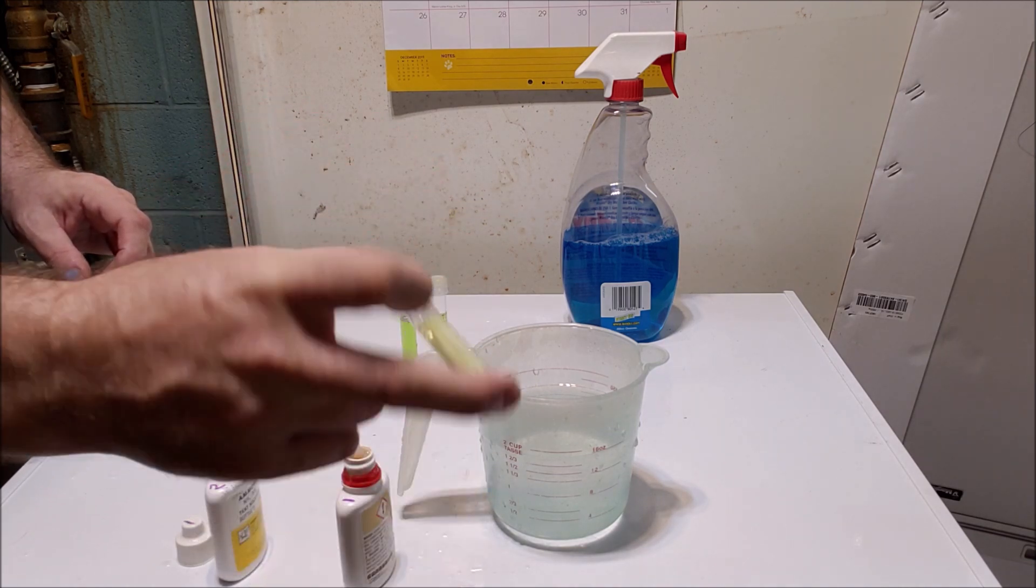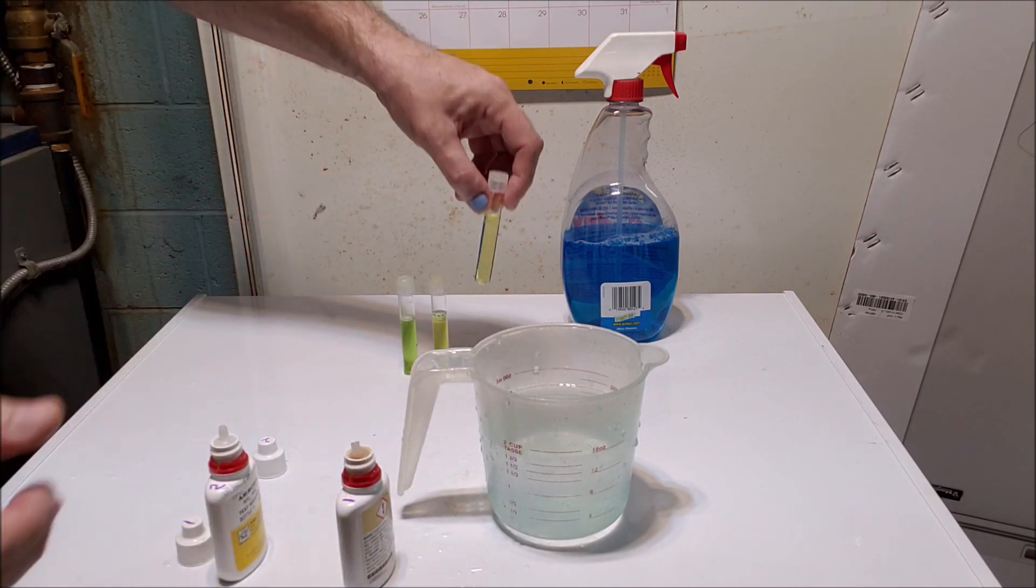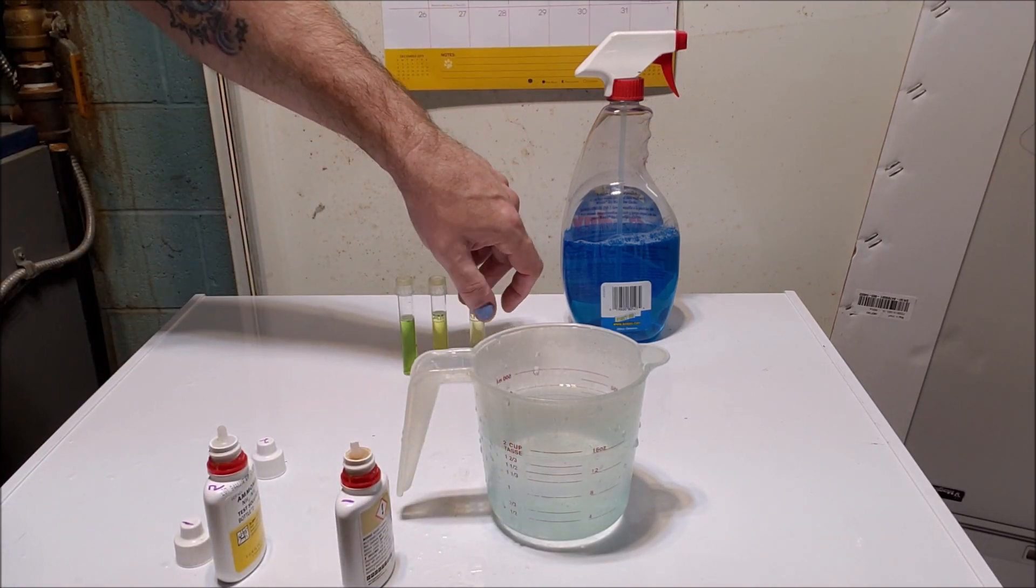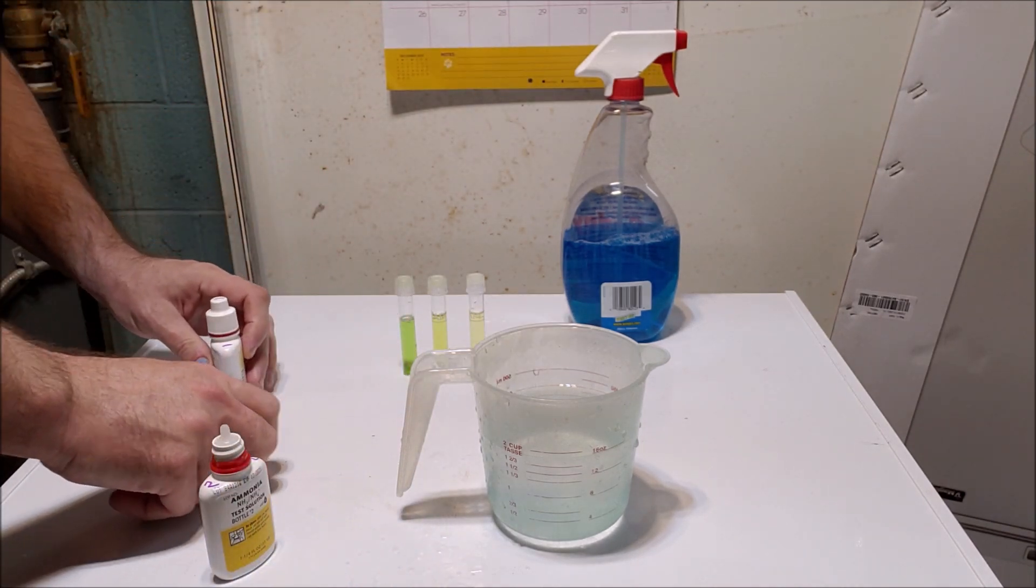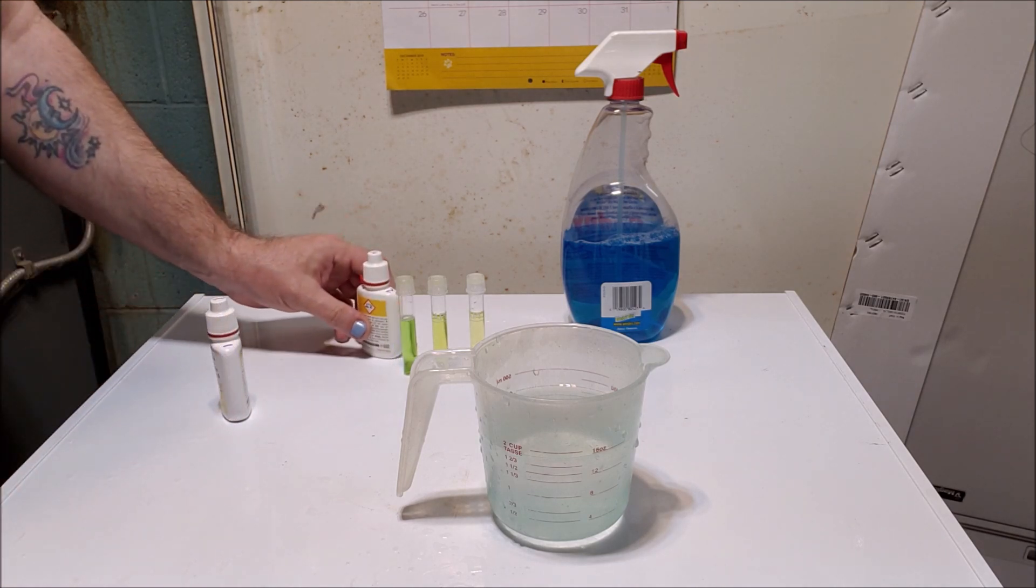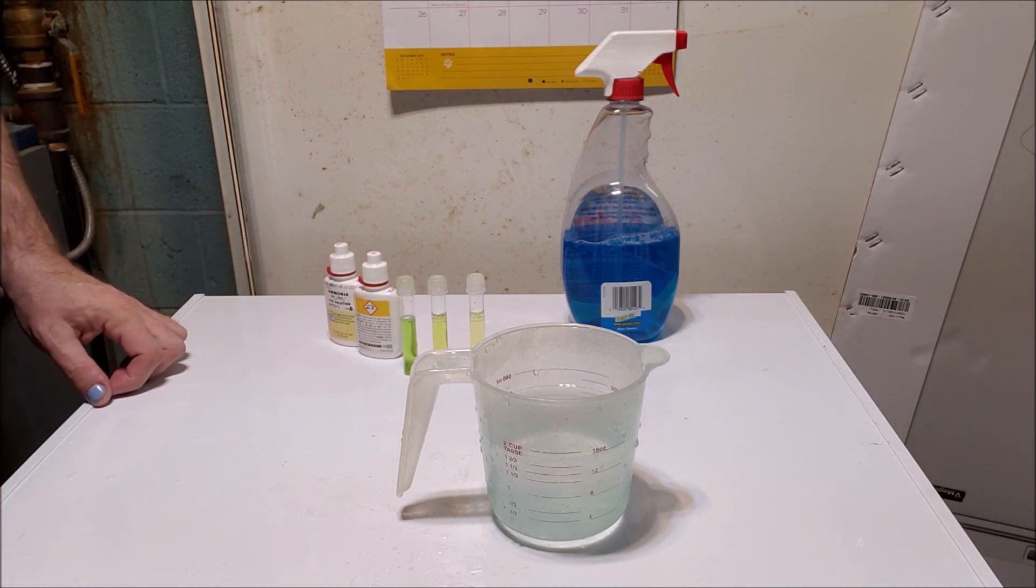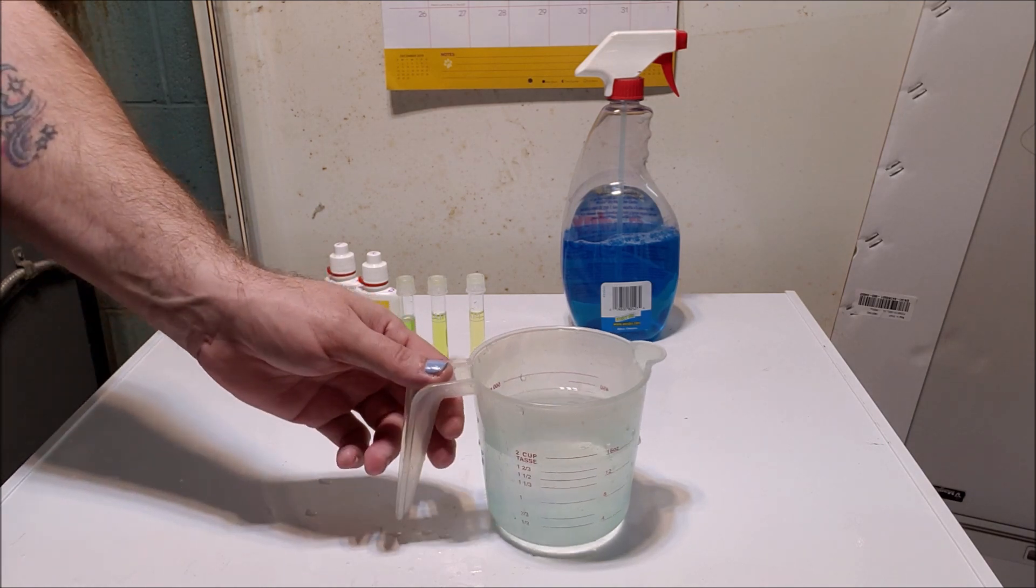And we're already getting a clear color change on the first vial. So it'll take a little while for the second two to catch up. So we'll give that a few minutes.